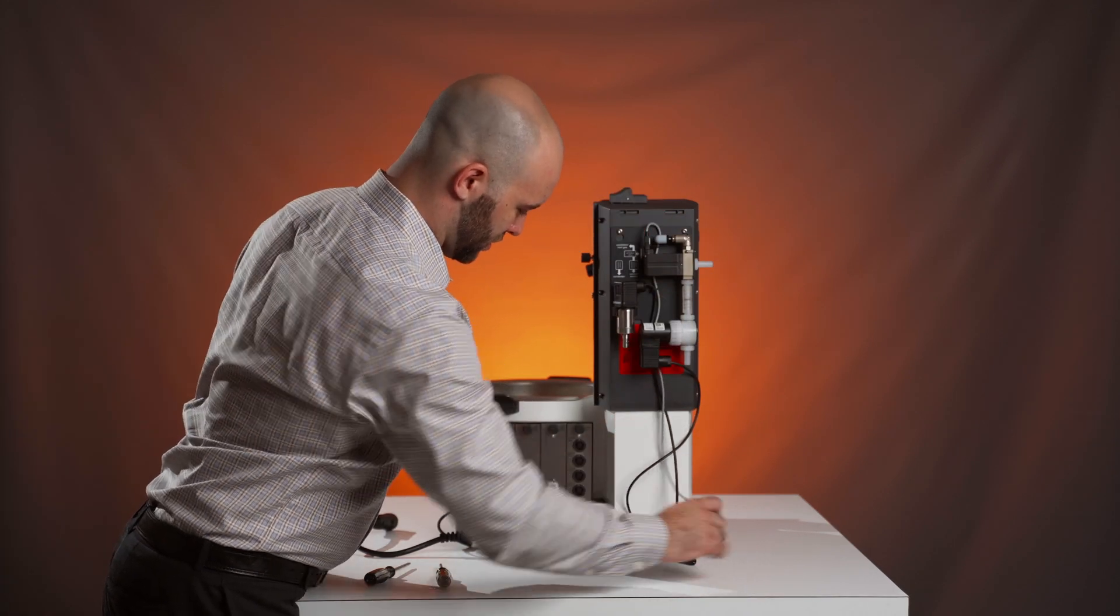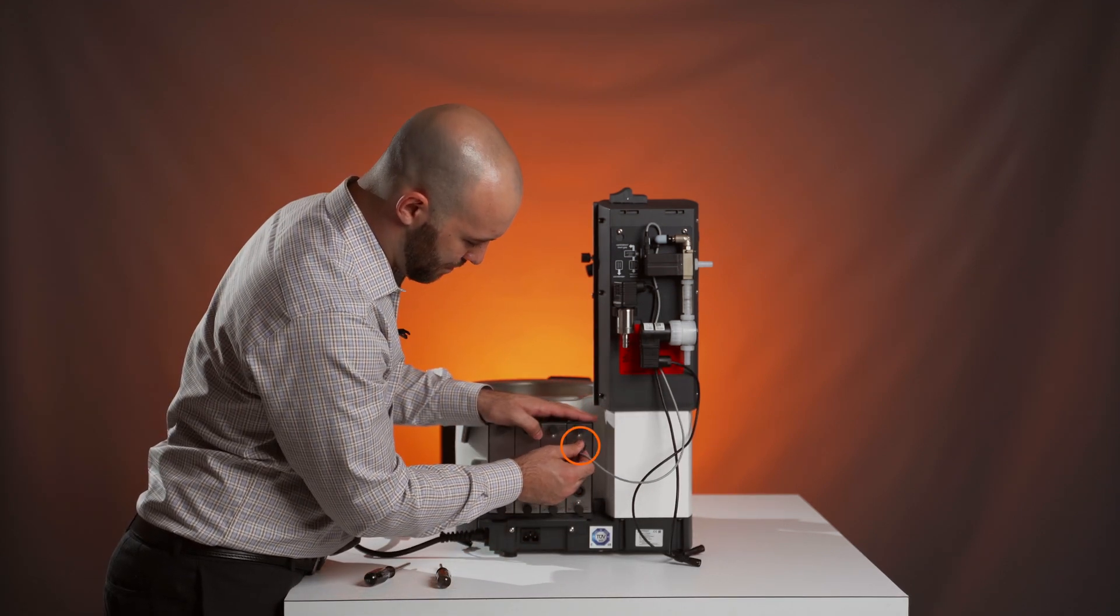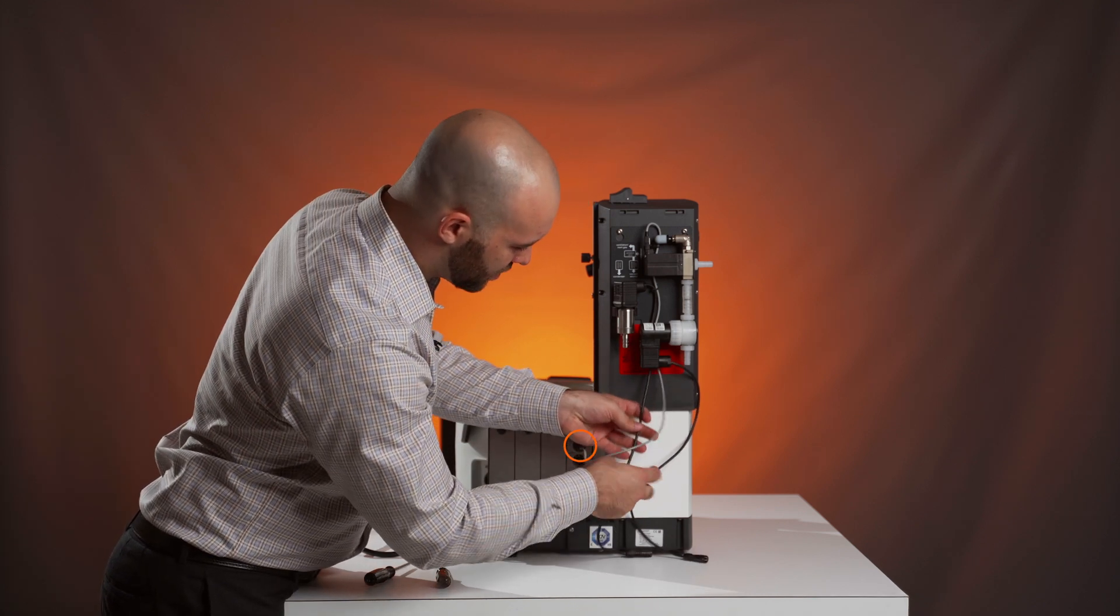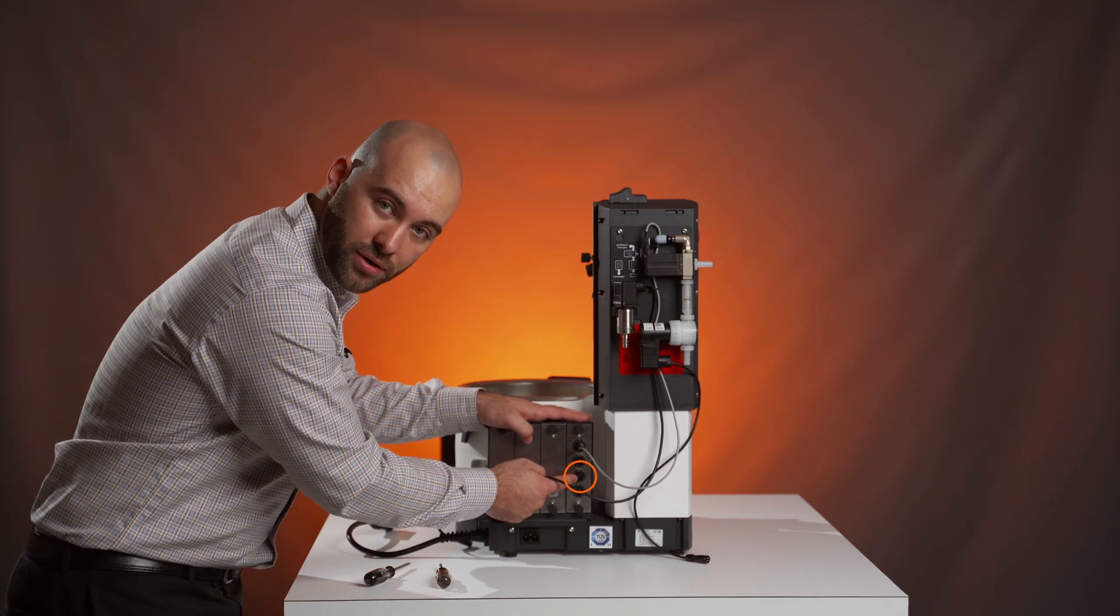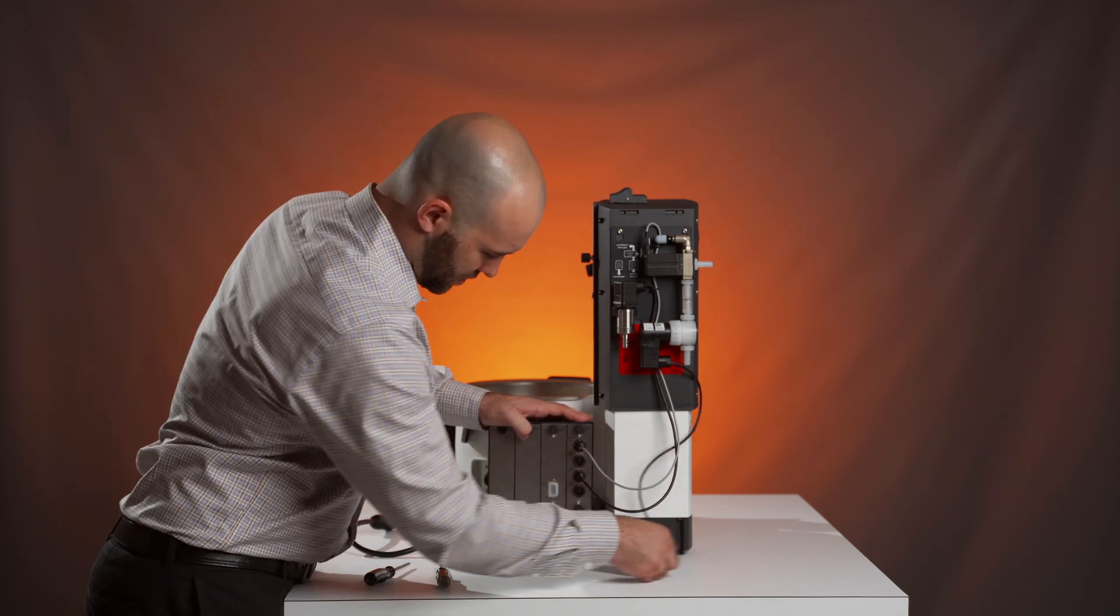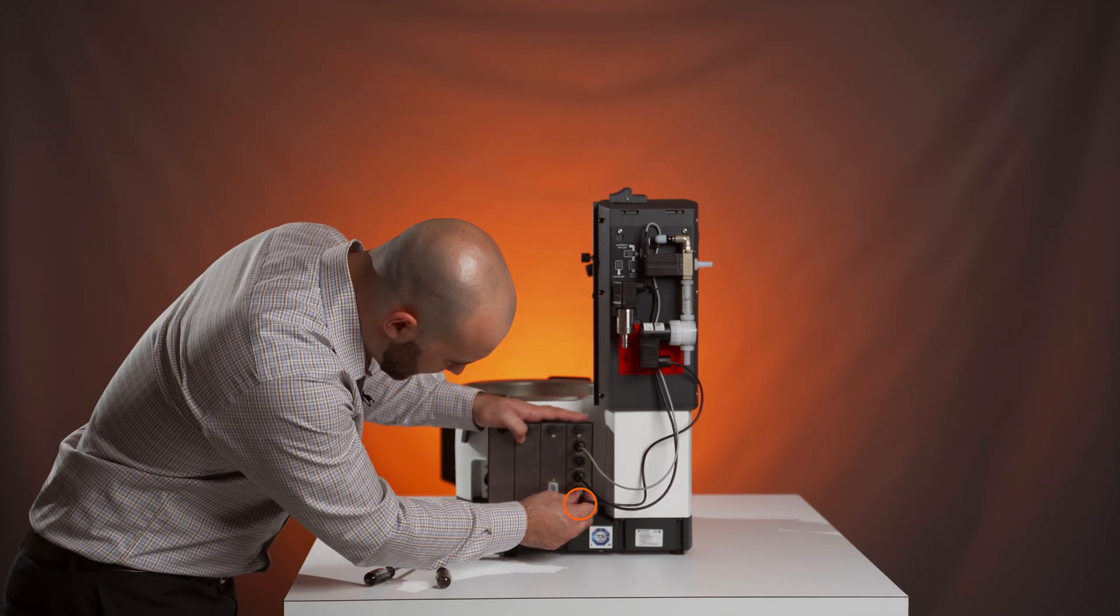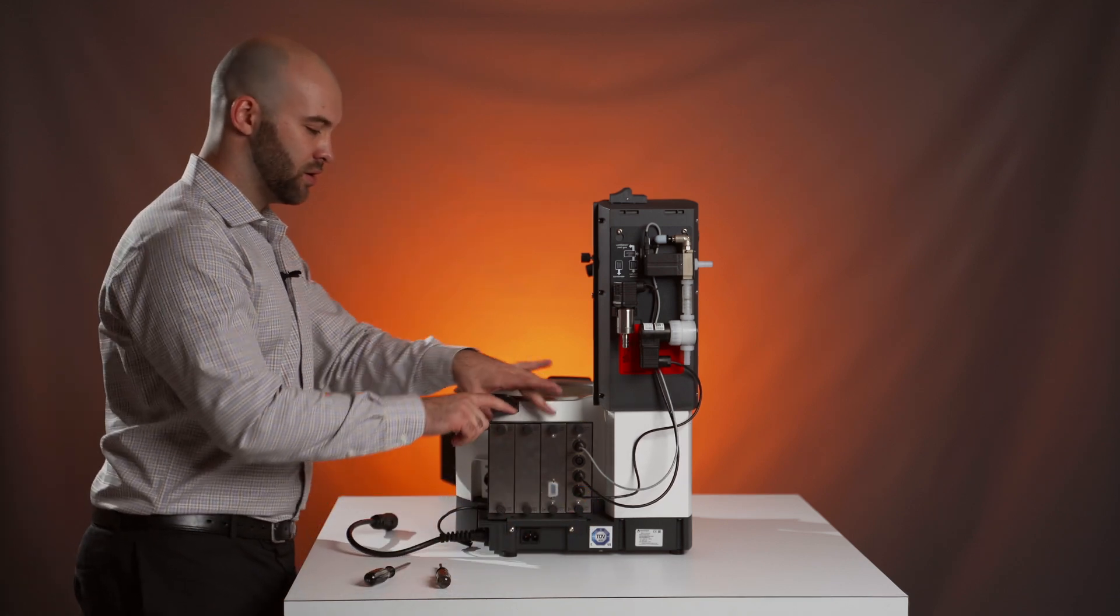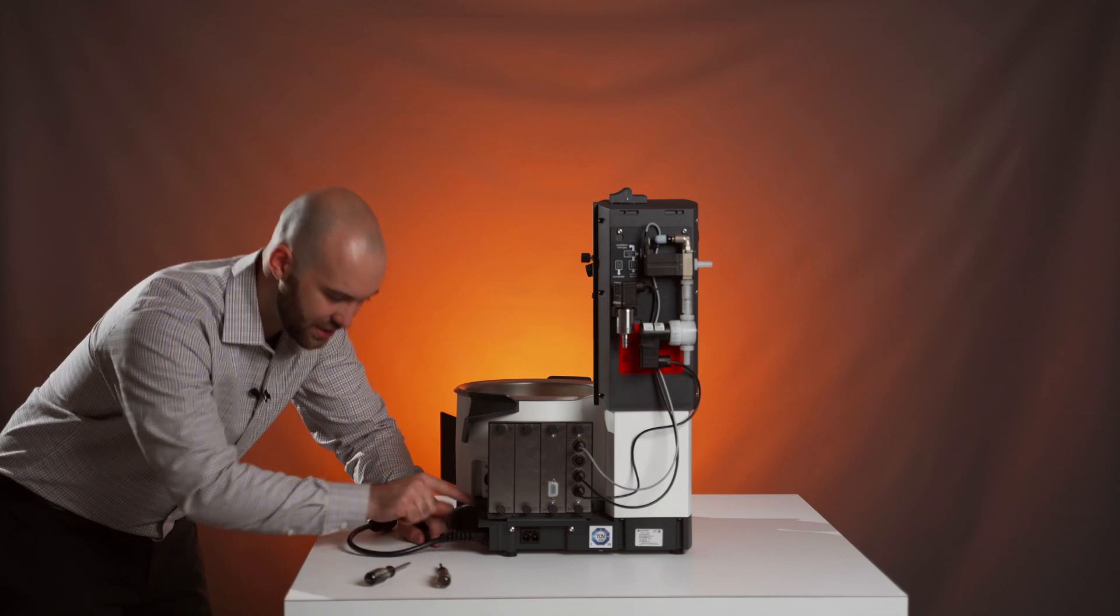It's a gray cord. It's the aerating valve. That'll be at the top. The black cord connected to the vacuum sensor will be the third plug labeled vacuum sensor. And the vacuum valve that you just attached will go in the bottom where it's labeled vacuum pump slash vacuum valve. And lastly, we'll hook the vacuum box itself into the rotary evaporator where it says control box HiVap.